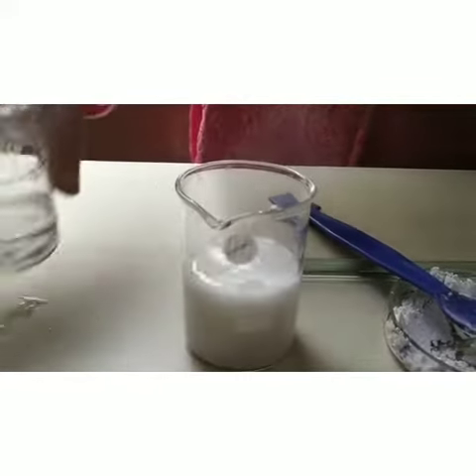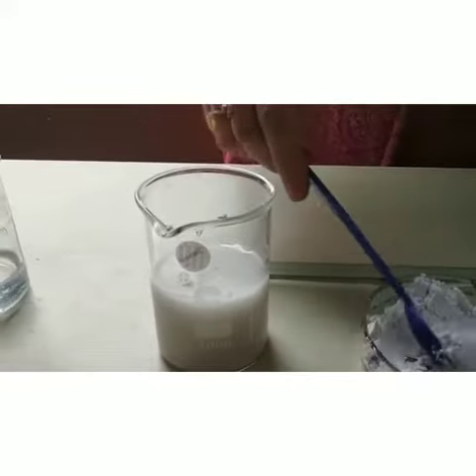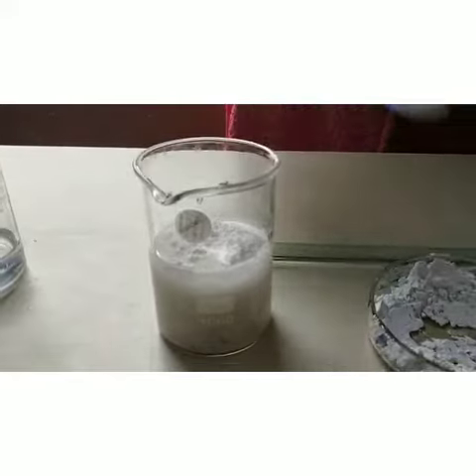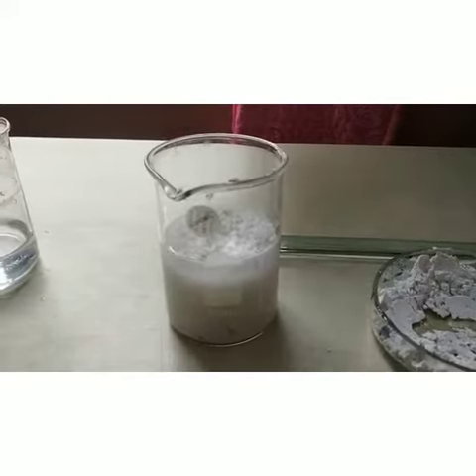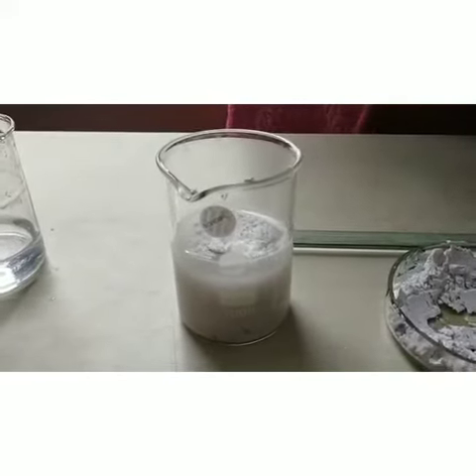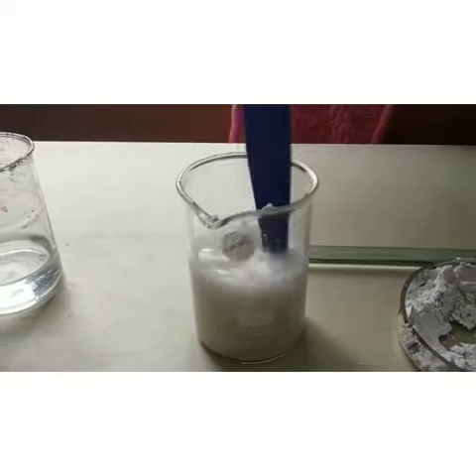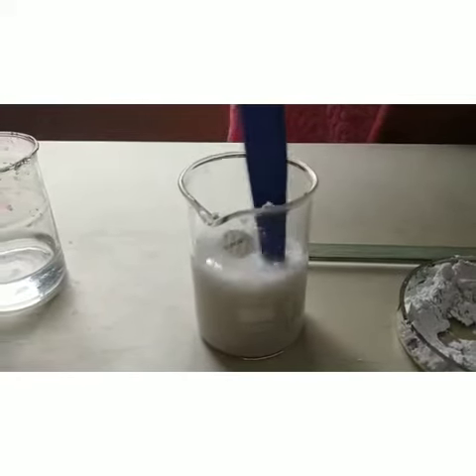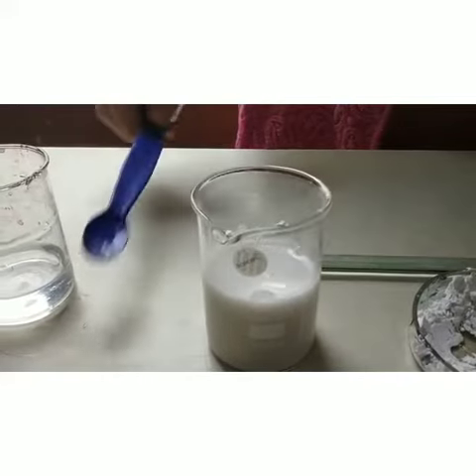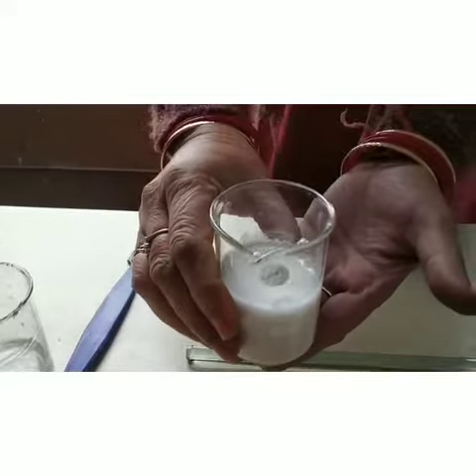Here you can observe that the fumes are generated due to the generation of heat. After few seconds, if you will touch this beaker, we will feel that it becomes hot. Why it becomes hot?